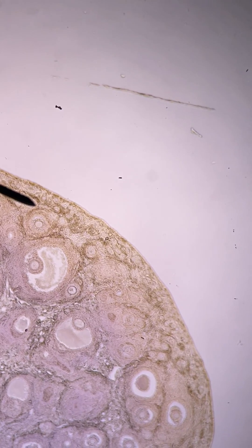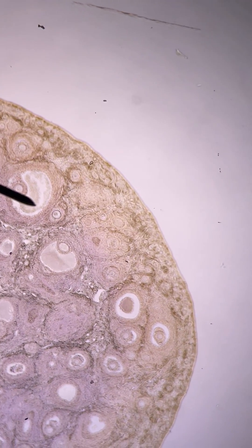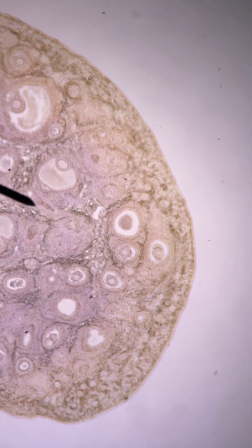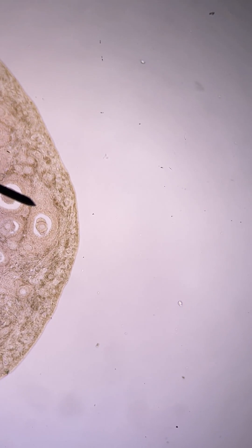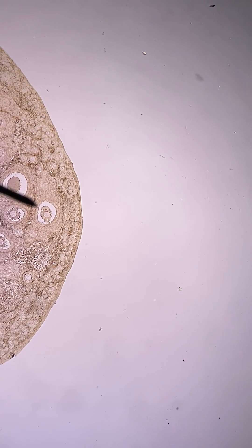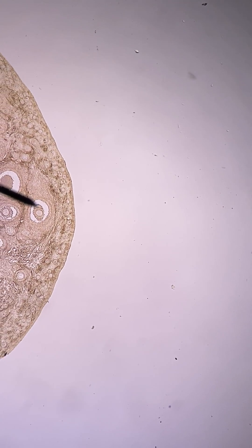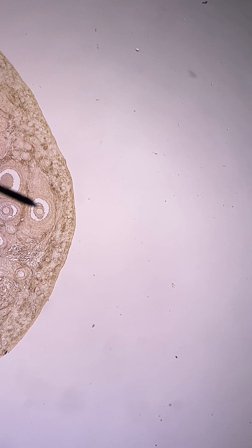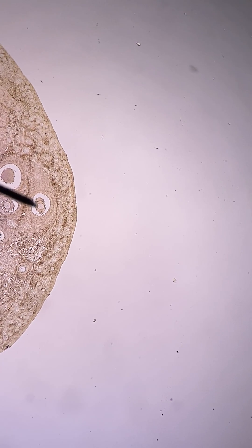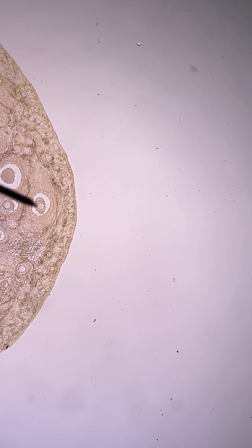Secondary follicles are when you get a little bit of breathing space, so maybe something like this one — this would be a secondary follicle. And you can see in many of these cases there's an oocyte inside. That little structure at the end of the pointer there is an oocyte.